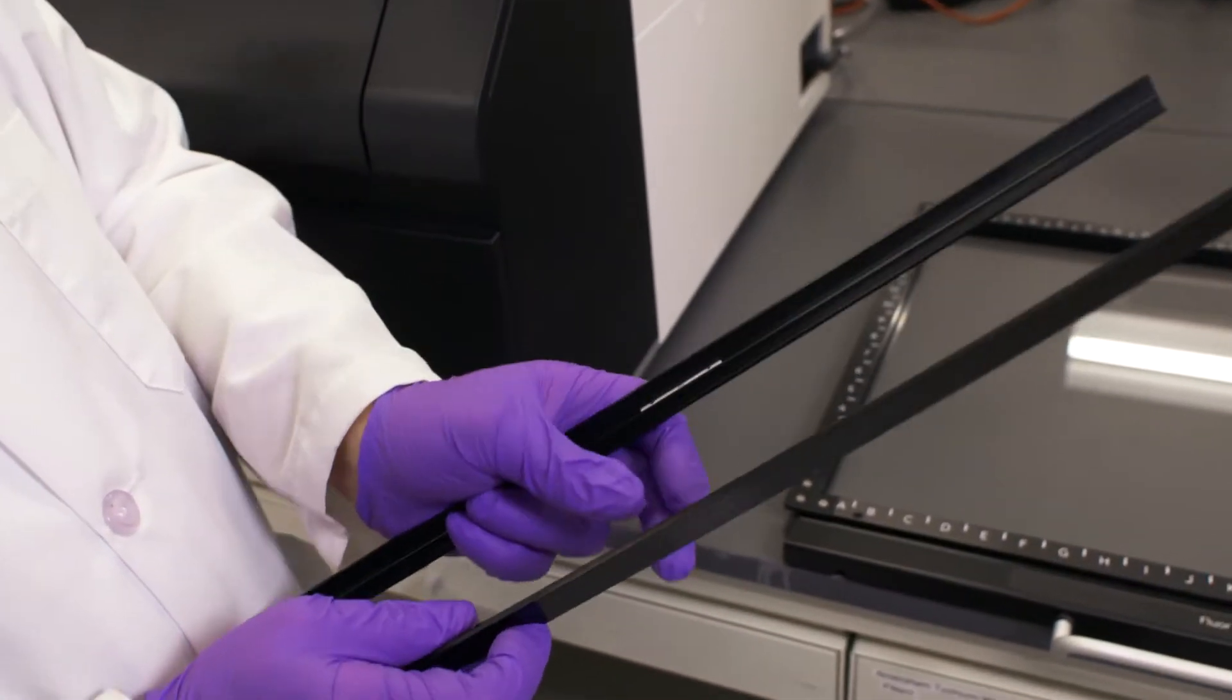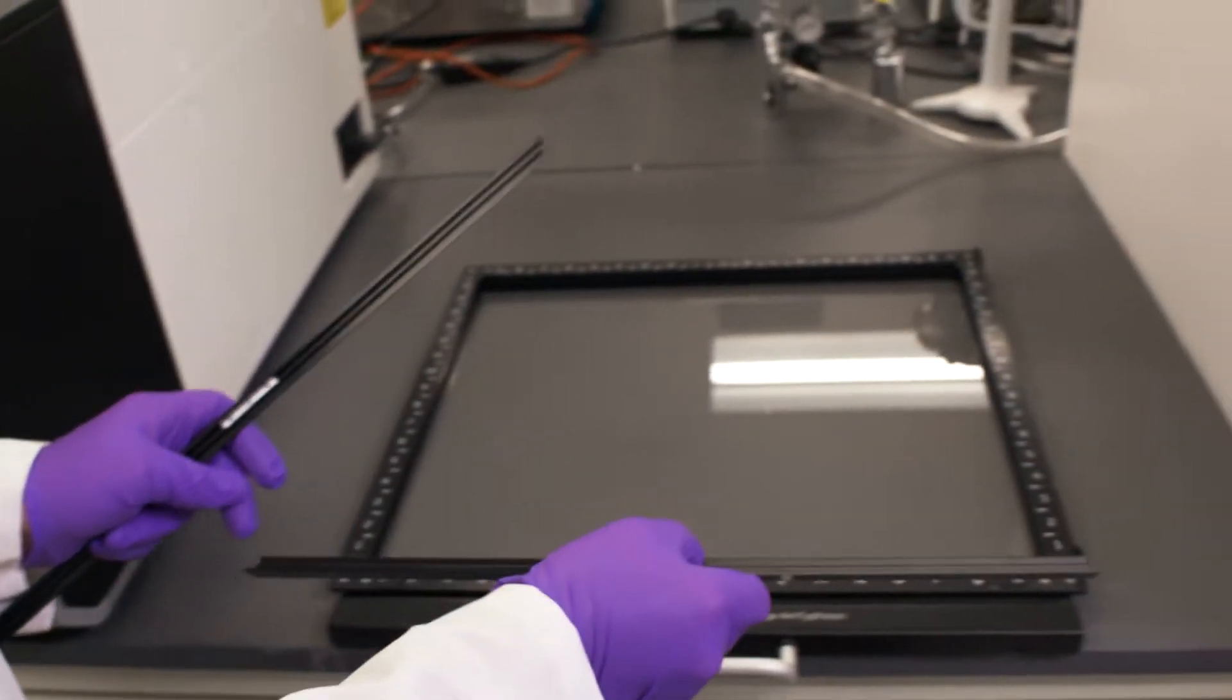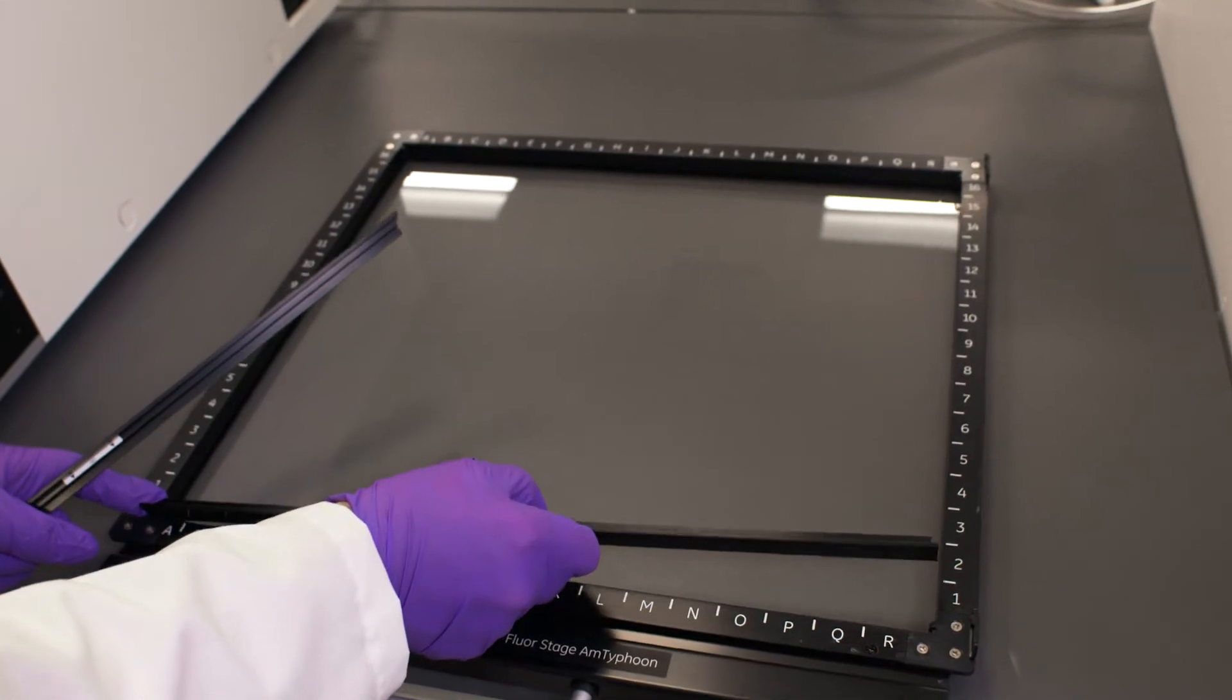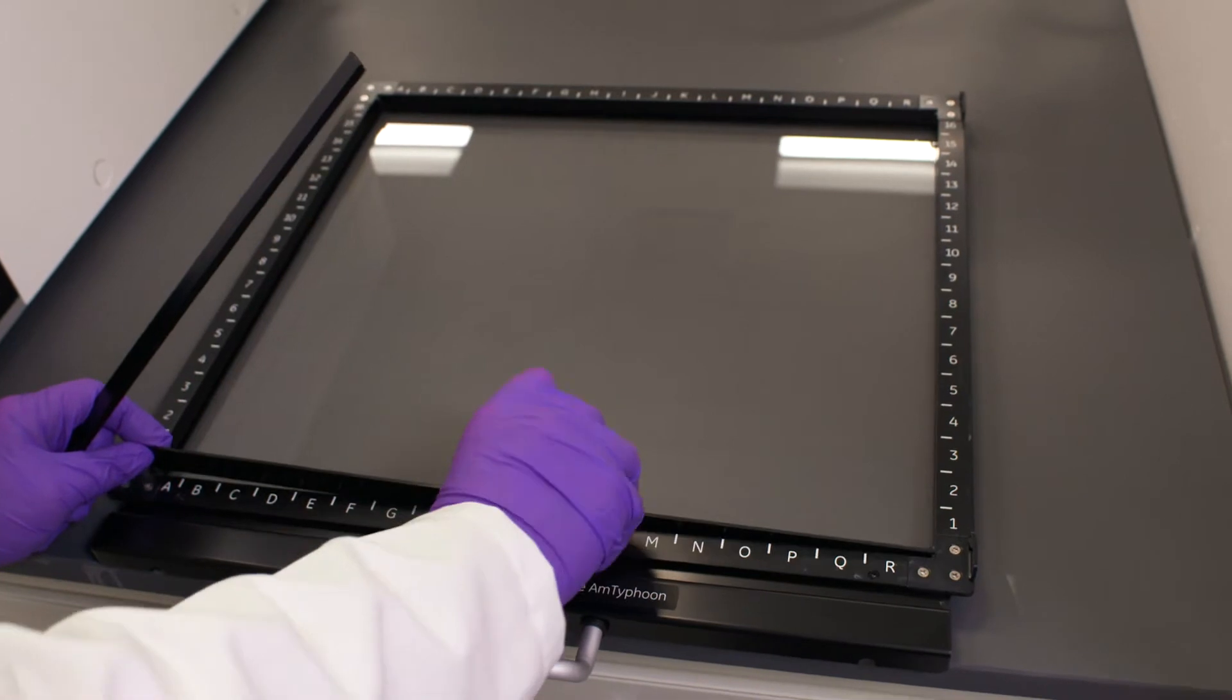In this instance, we're going to use it in this orientation for doing densitometry, so we'll have the OD facing up. When we look at the low fluorescent glass stage, we're going to place those brackets at either end with that OD facing uppermost.